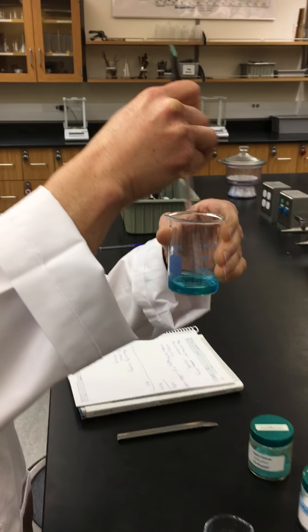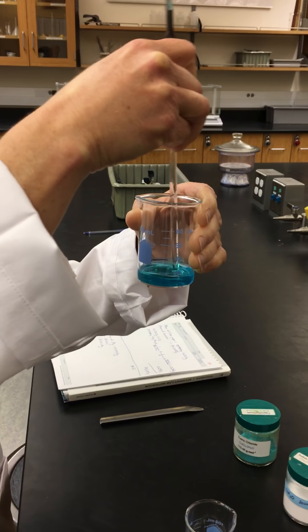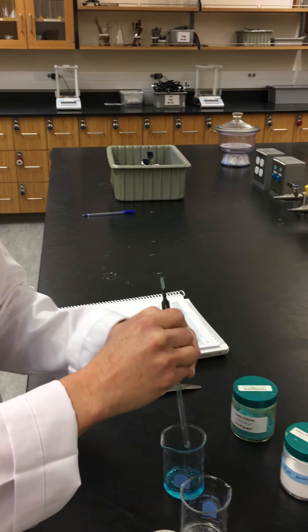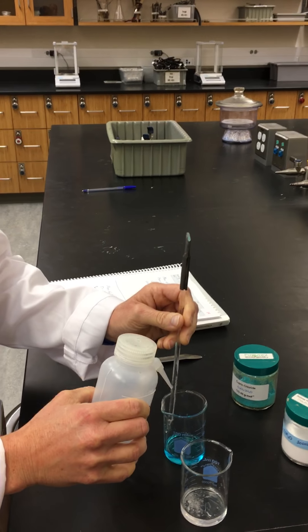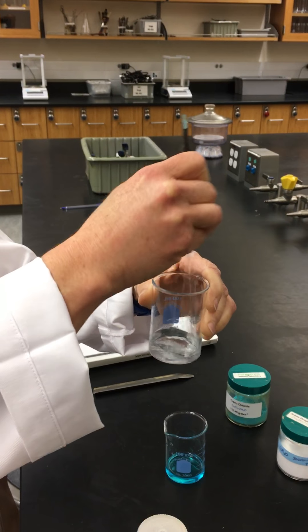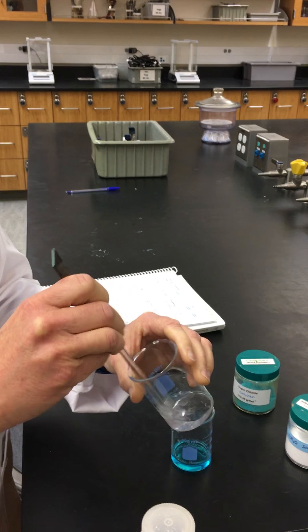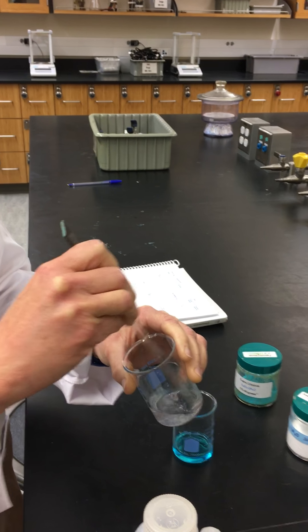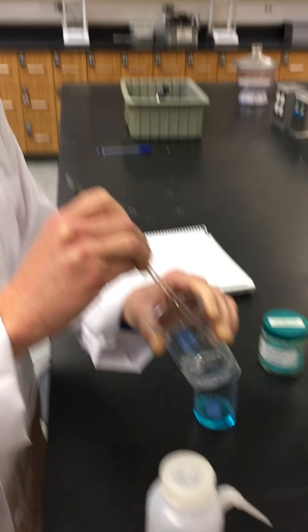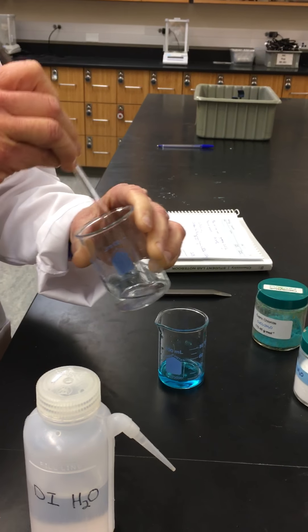You can see the copper chloride has a very nice teal color. Now that this is in solution we're going to get our sodium phosphate into solution — this one takes a little longer. This chemical reaction is similar to the reaction we were doing in experiment number eight when we were looking at solubility.